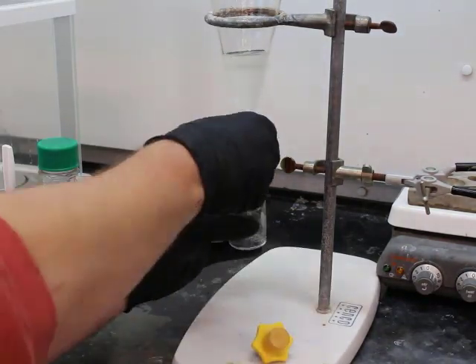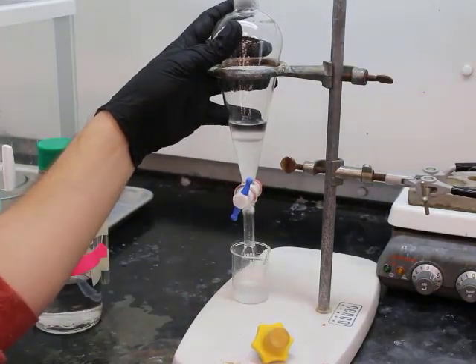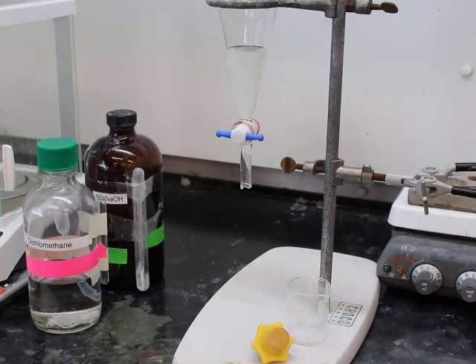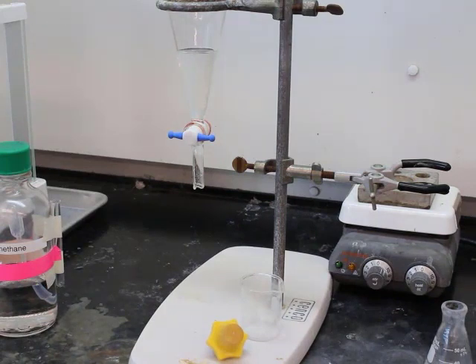So then going to allow it to settle, and then go ahead and remove the bottom organic layer again. Remember we added a base, so that organic layer should possess our basic compounds or our neutral compounds if they're present. And so the basic layer, the aqueous layer that we took off, that would have our acids in it if we had an acid. So added the organic layer back. We have that sodium hydroxide extract layer chilling in an ice bath per our instructions.